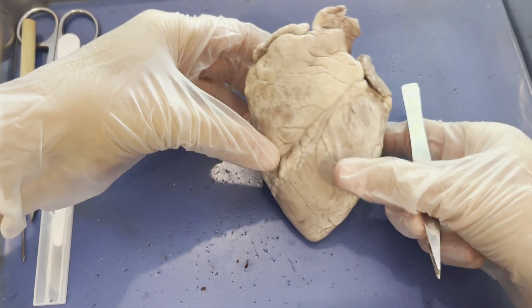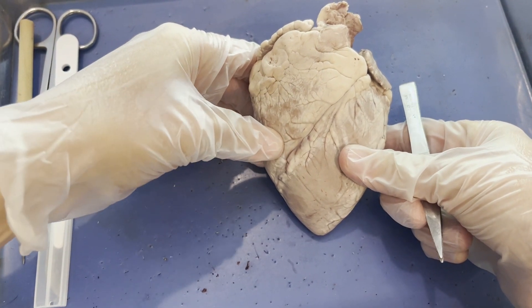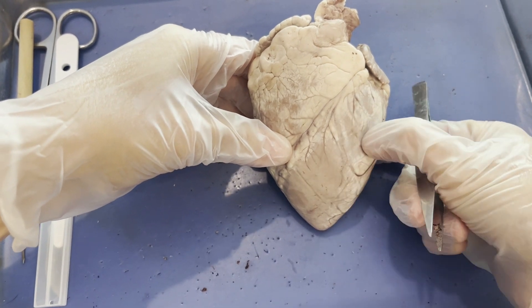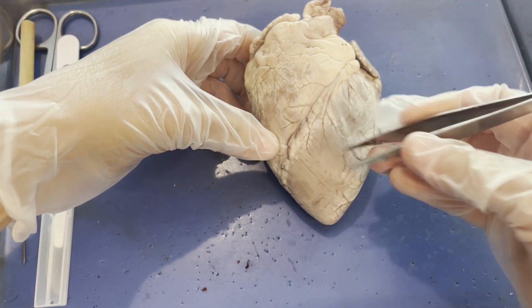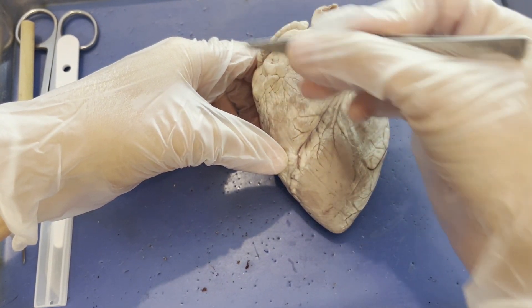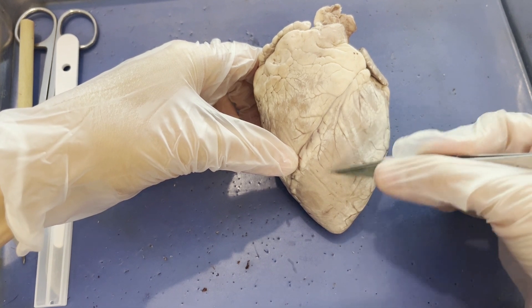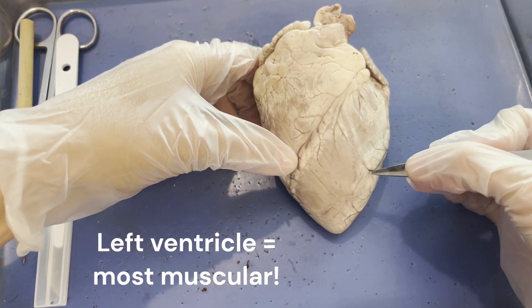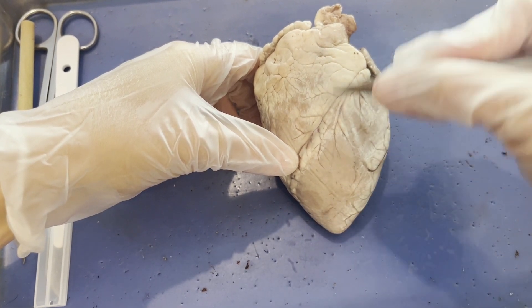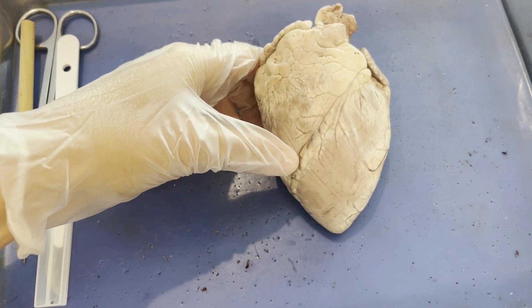When we feel the muscle on the left and right sides of the heart, I can push my fingers in and feel space on the right side, whereas the left side is super meaty. That's because the right ventricle only has to pump blood to the lungs, so it is less muscular. The left ventricle is the most muscular and largest chamber of the heart because it has the most complicated job — pumping blood to the entire body through all 60,000 miles of blood vessels.